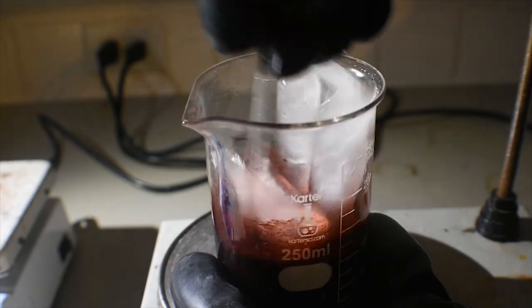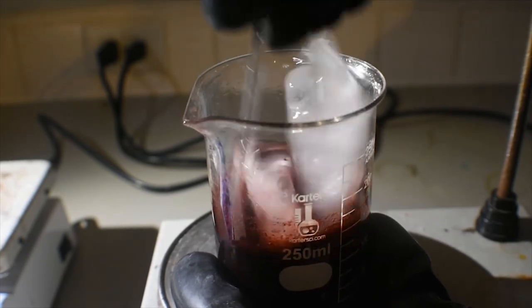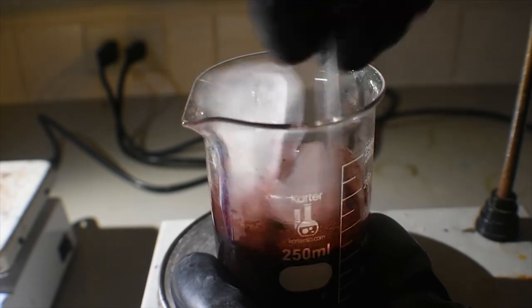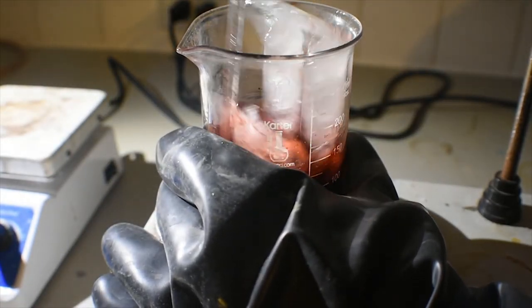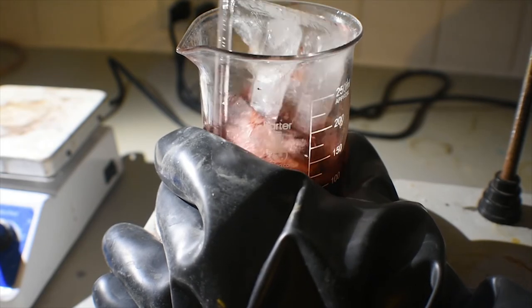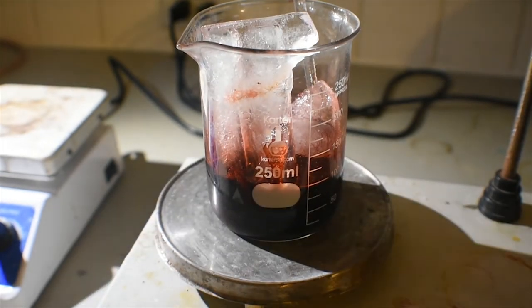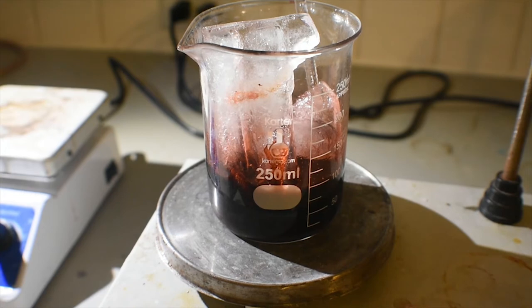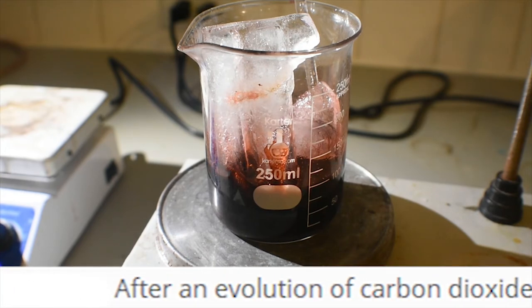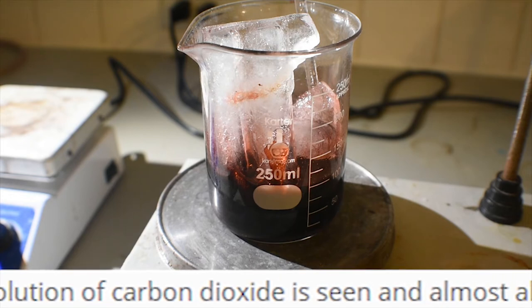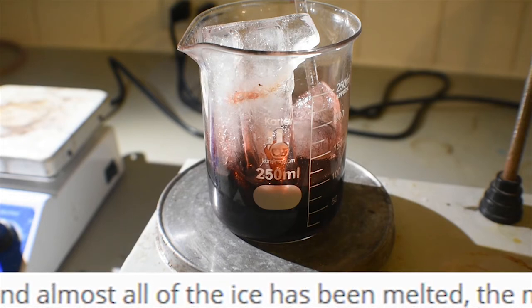It's going too fast. I'm tired of stirring. After an evolution of carbon dioxide is seen, and almost all of the ice has been melted, the mixture is filtered.